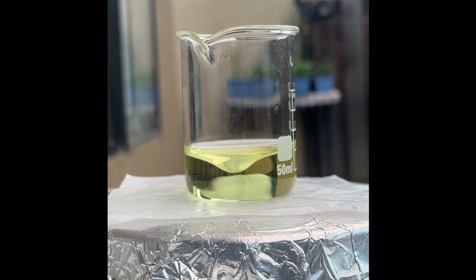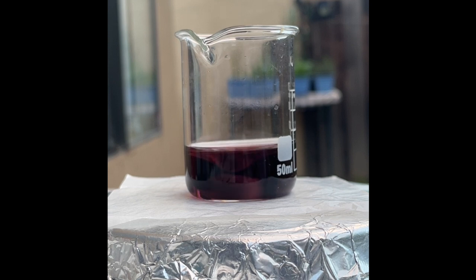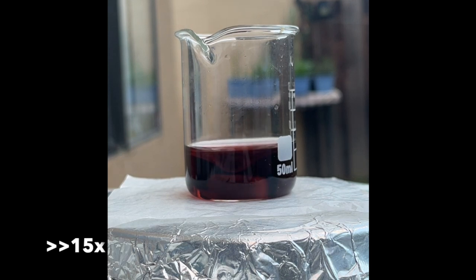Then, upon adding ferroin, which is solution D, we can observe a wide variety of color changes immediately, which is fascinating. However, over the next several minutes, the solution gradually changed color from a dark brown to red, very slowly, but no oscillation occurred. This made me a bit worried for a moment. To speed up the reaction, I turned on my heat plate. That's why you can observe some steam on the beaker. However, after a while, nothing seemed to be happening yet.